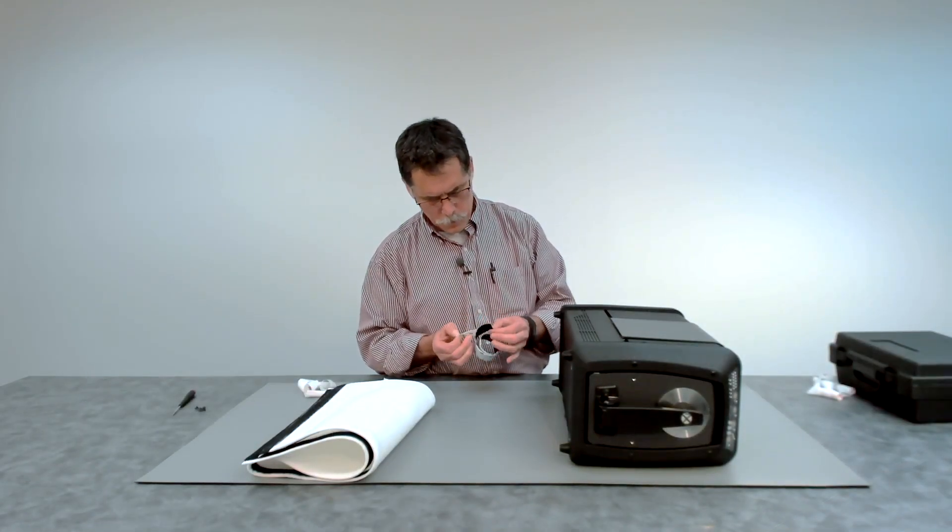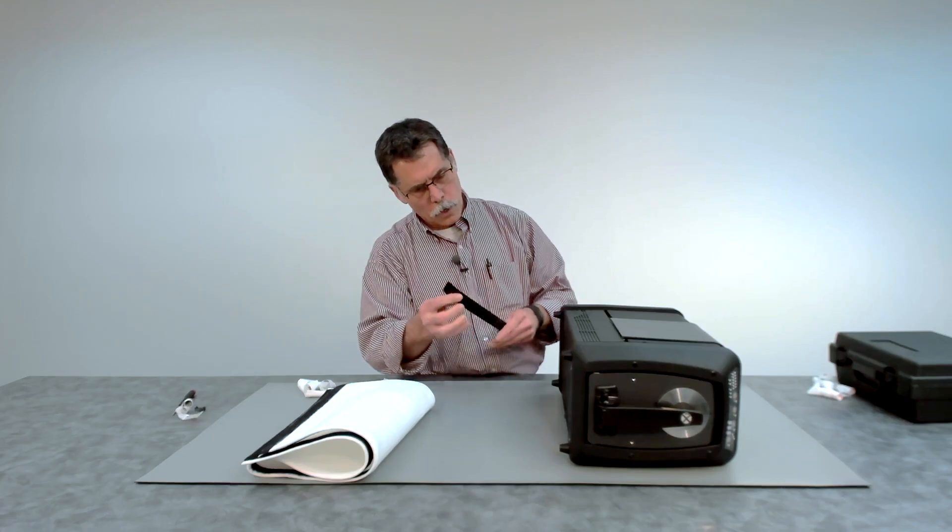The last piece of Velcro runs centered along the bottom of the instrument.